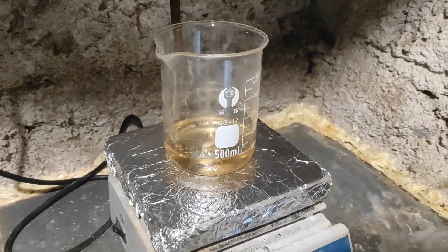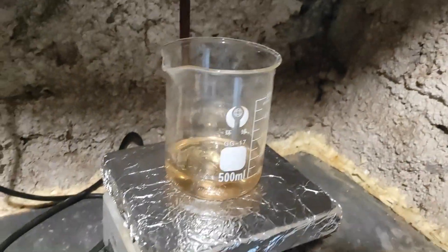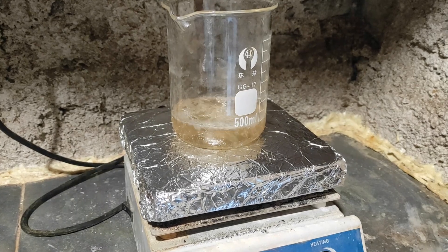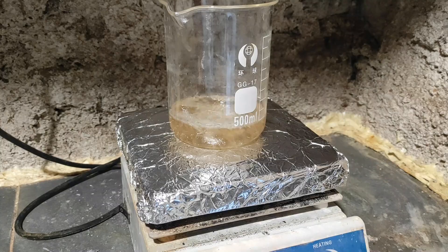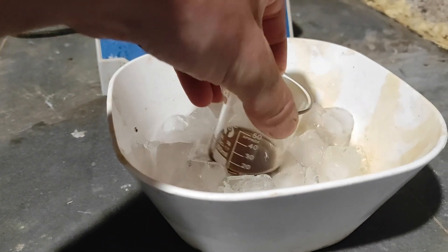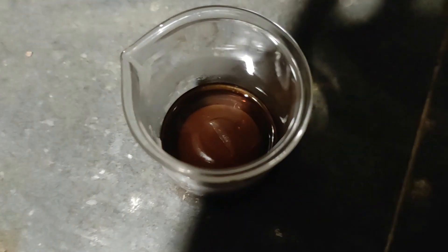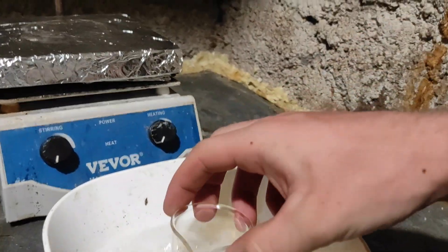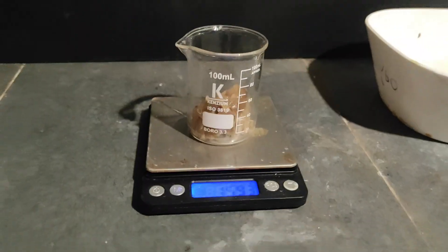Now we're just going to boil this in order to boil the toluene off. In the end we are left with about 20ml, which I guess is an okay yield. I just want to show you that it's a solid crystalline form — to do so we just need to chill it in an ice bath for a few minutes. When it's done it makes those beautiful concentric needles, and this whole thing weighs about 16g, which is well enough to continue.